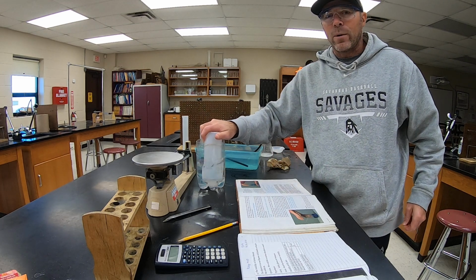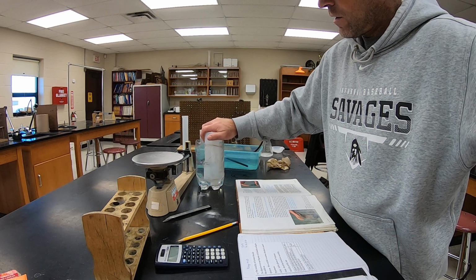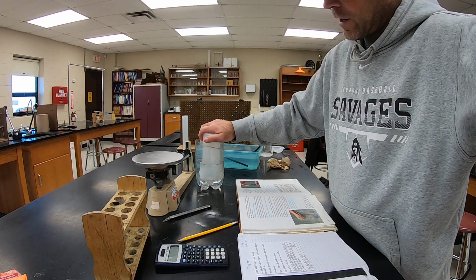So I'm going to turn this off. There'll be a part 2 for this here in a few minutes, after we stir this for, I don't know, 10 minutes or so.